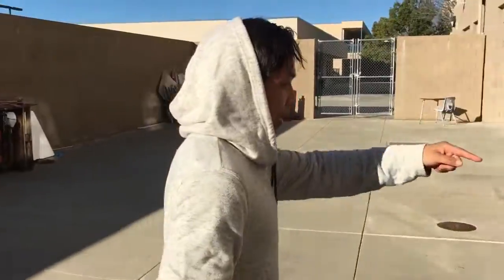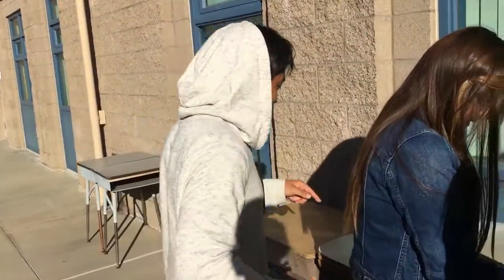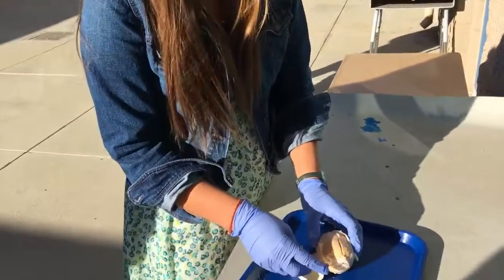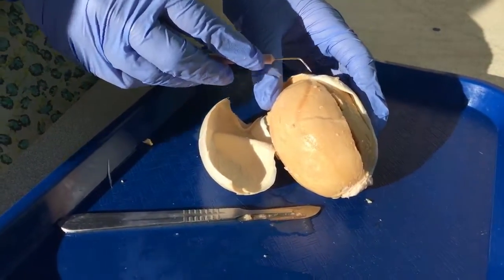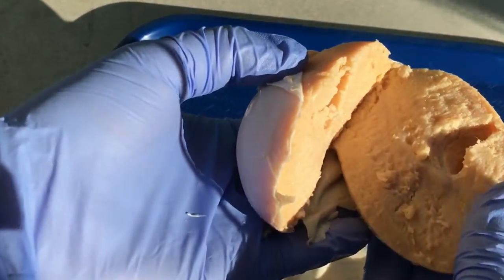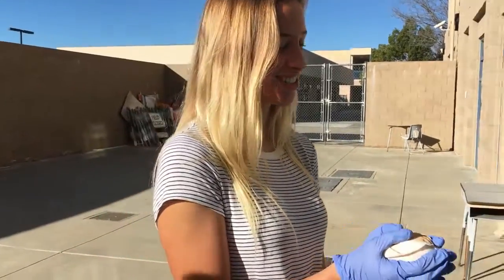I'm Dr. Rick Martin. Here are my assistants Travis, Trisha, and Bethany. We dissected sheep testicles. My assistant Travis will explain. This is a sheep's testicle. This is the head of the epididymis. This ridge right here is the epididymis. So you open it up — inside the sheep testicle there are seminiferous tubules. Hi, I'm Trisha.